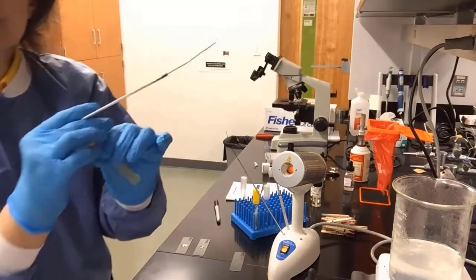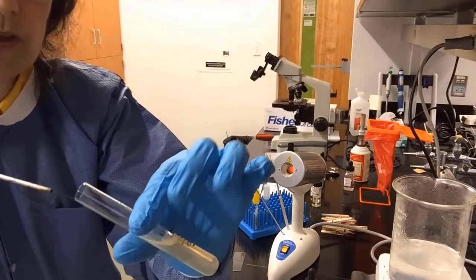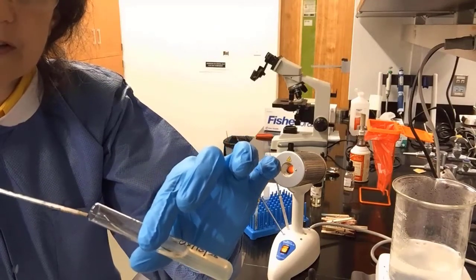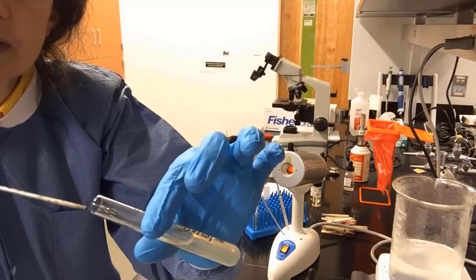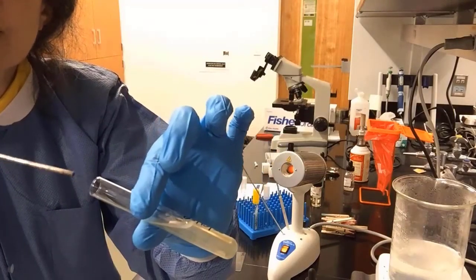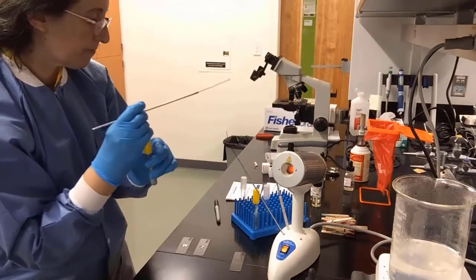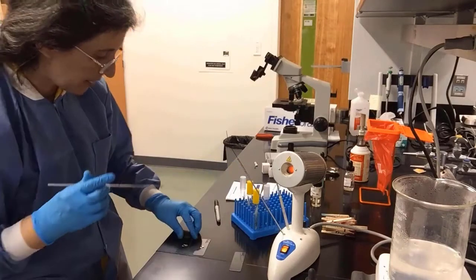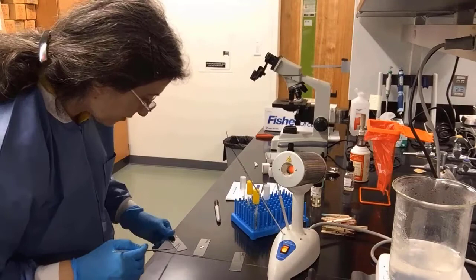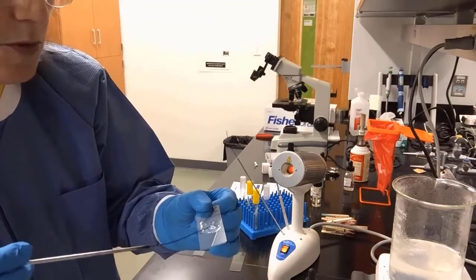We pick up our staph with a clean, sterilized loop. We go in and gently scrape off the surface, not the agar, but the actual bacteria. I don't know if you can see that. There's some bacteria that are kind of liquidy there. This is staph off the surface of the slant. Again, we don't want to pick up too much of a sample, just enough to smear in the drop of water that we placed. We create a quarter-size smear, as you can see here.